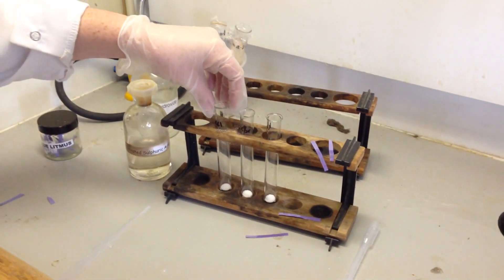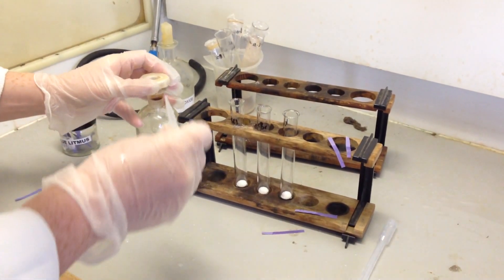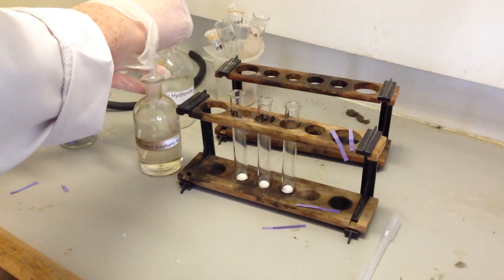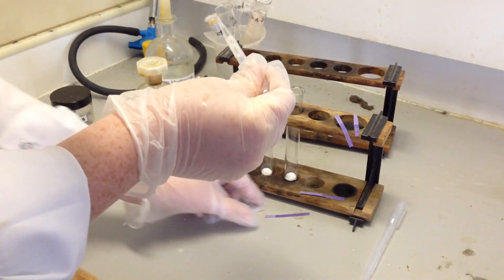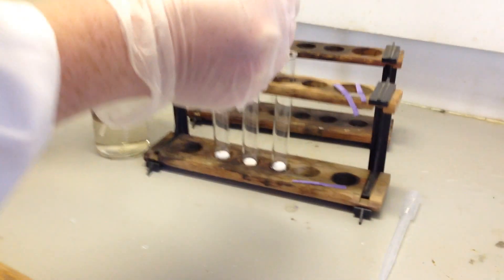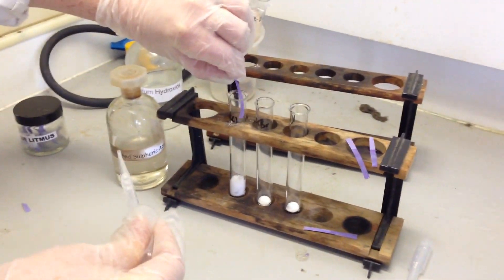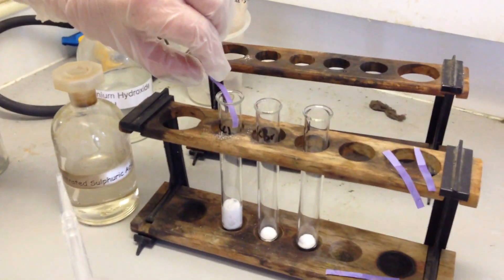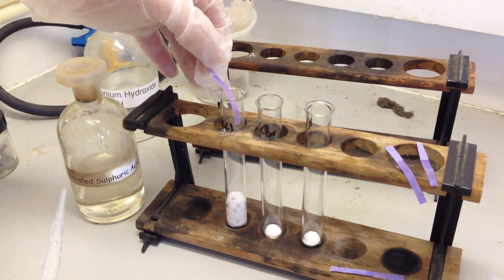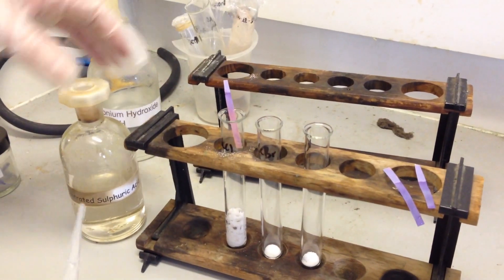So here we have solid versions of the halide ions. I'm just going to add a couple of drops of concentrated sulfuric acid. Working in a fume hood because concentrated sulfuric acid is nasty stuff. And then we're going to test the gas that's evolved. You can see that fizzing away — I'm just going to pop the litmus paper in there so you can try and see what happens to some of the gas.